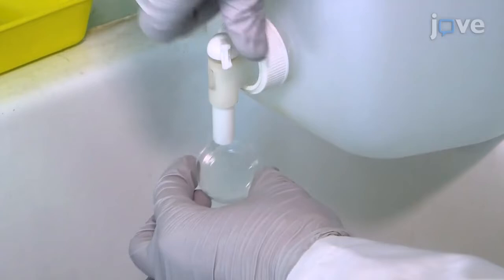Thoroughly wash the cover slip or glass bottom dish with ultra-pure water and dry it using vacuum aspiration.